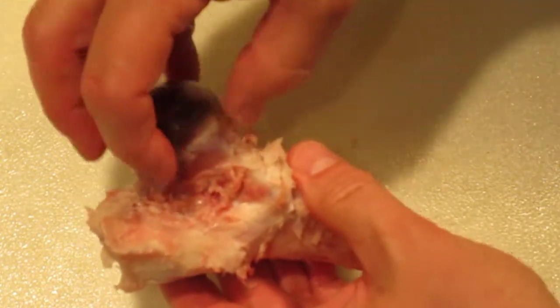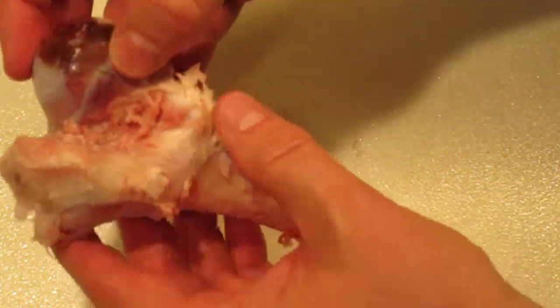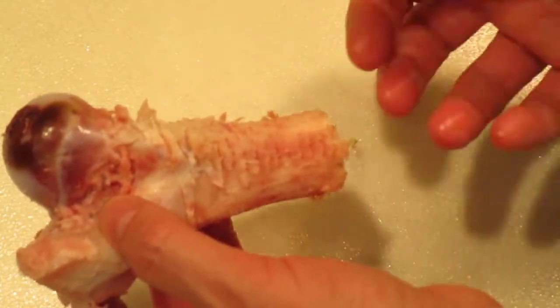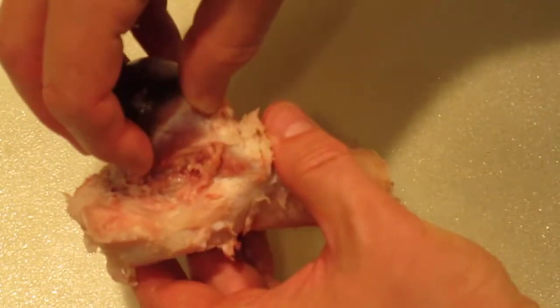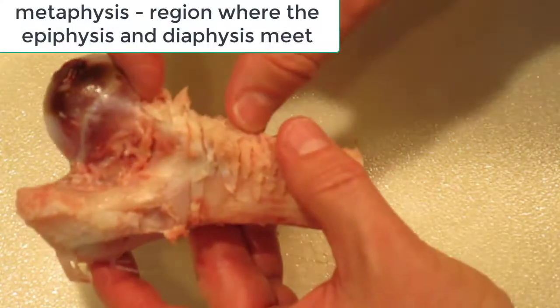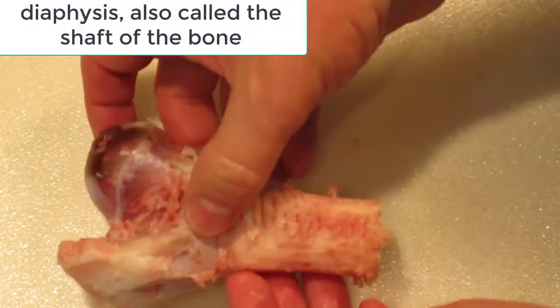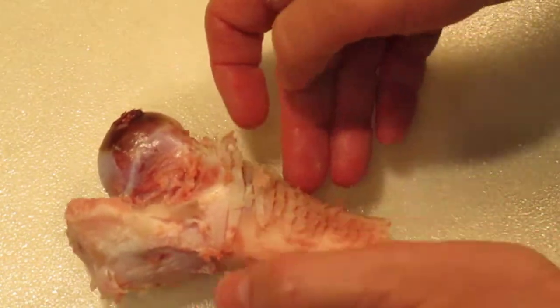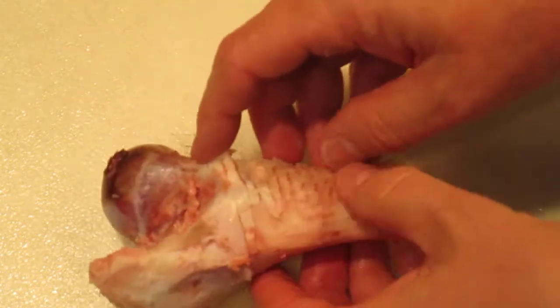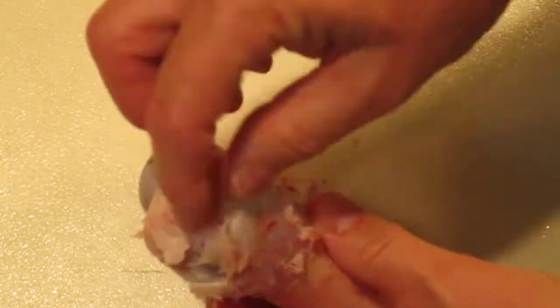This is the epiphysis when we're talking about the structure of a long bone. This is a long bone — it would extend on out like this down another foot or so. This region here is the metaphysis, where the epiphysis and the diaphysis come together. And this is the beginning of the diaphysis, the central part of the long bone.